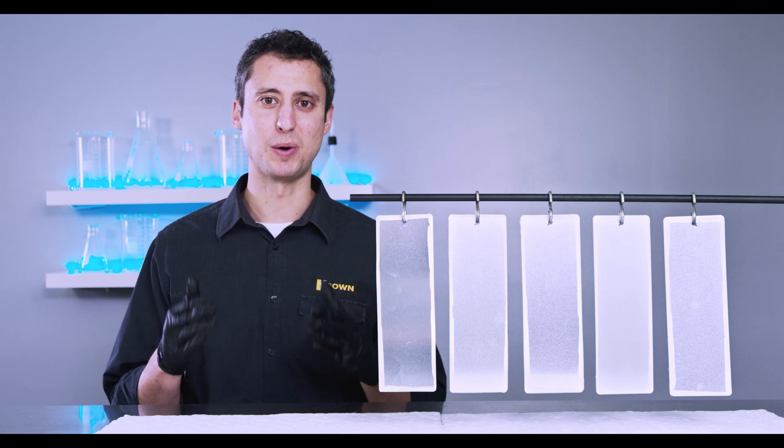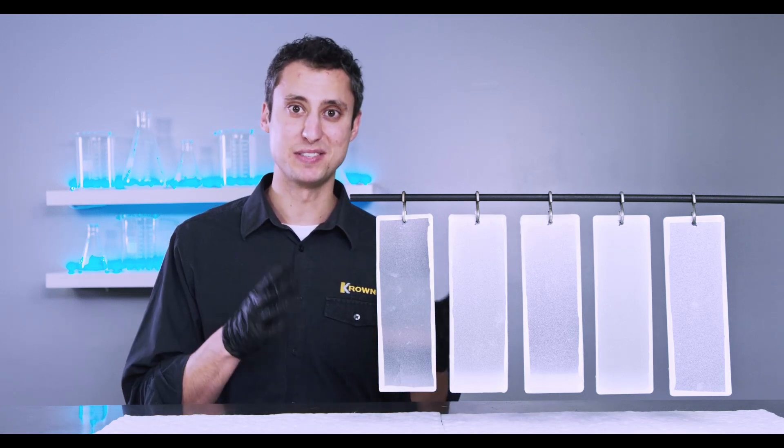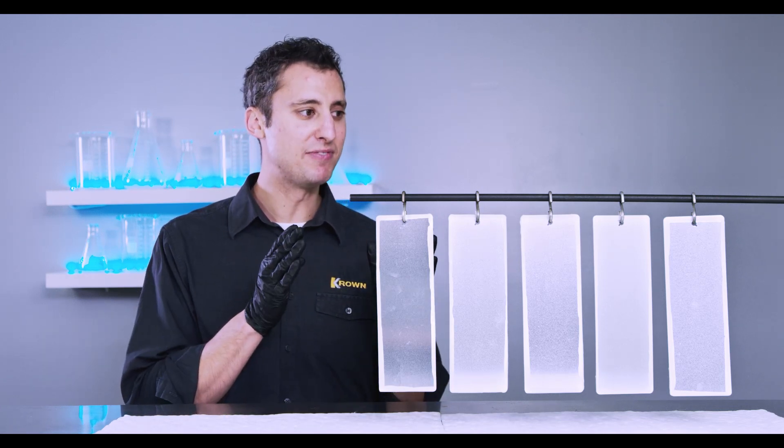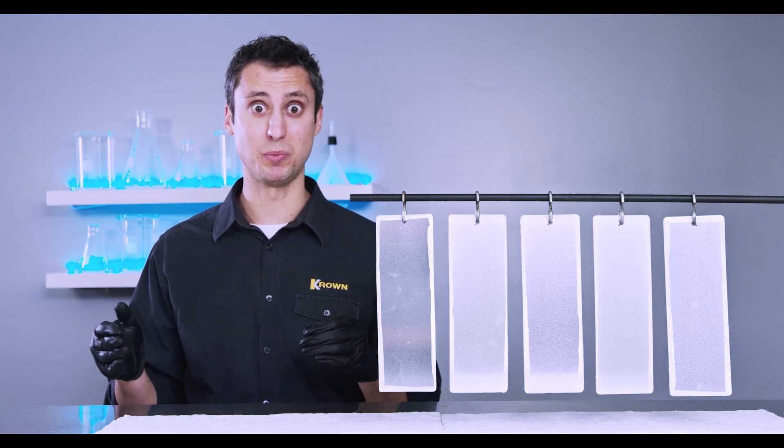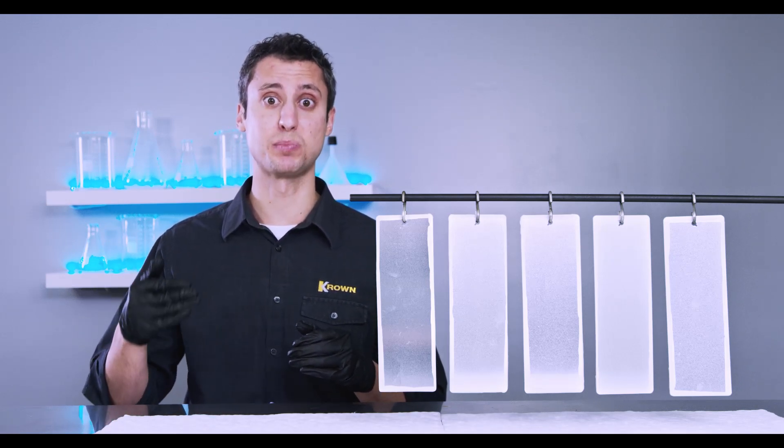Before we show you the salt spray cabinet, we're going to take a look at our five samples. So here we have five identical pieces of steel that we're going to apply five different products to and we're going to see how they hold up in the salt spray cabinet.